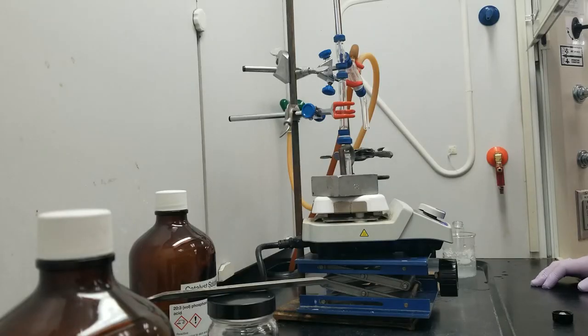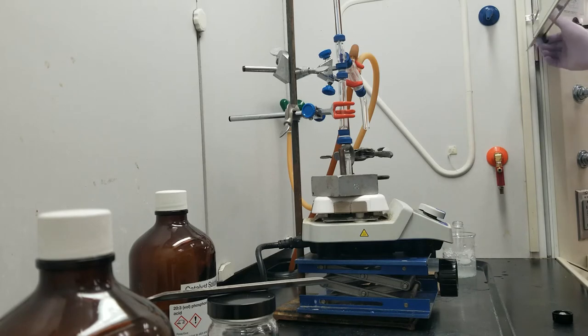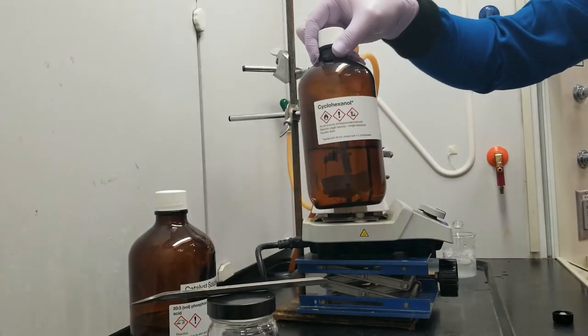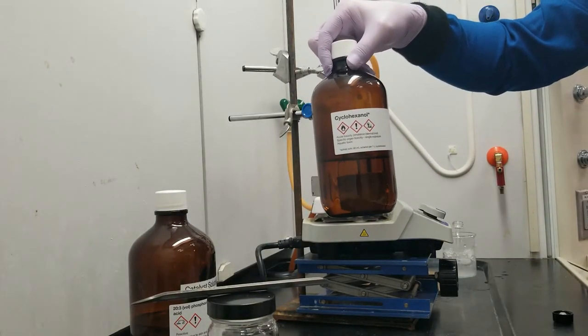Hi everyone, so today we're going to be doing an acid catalyzed dehydration of cyclohexanol to form cyclohexene.